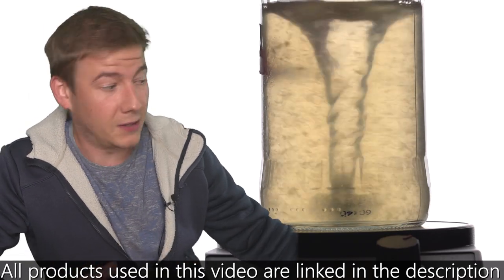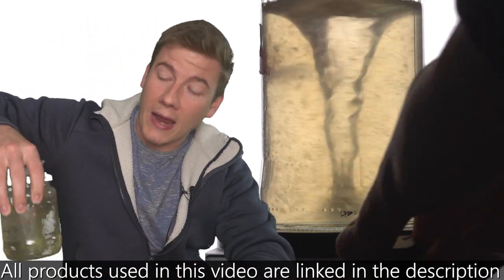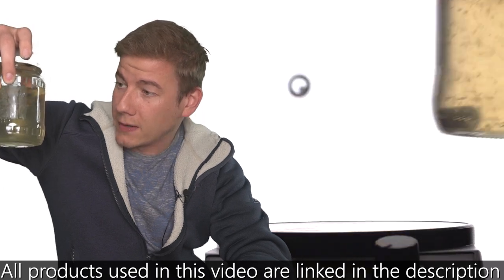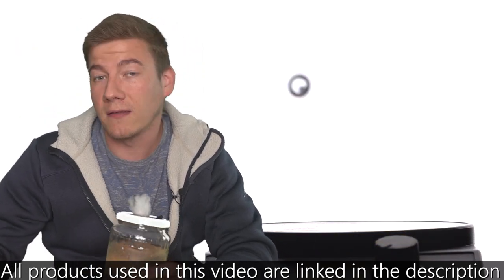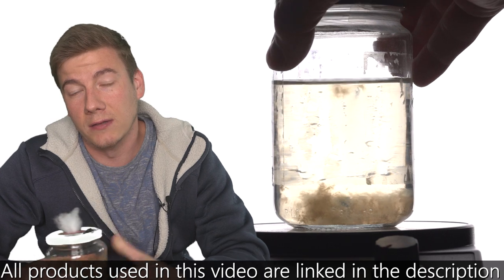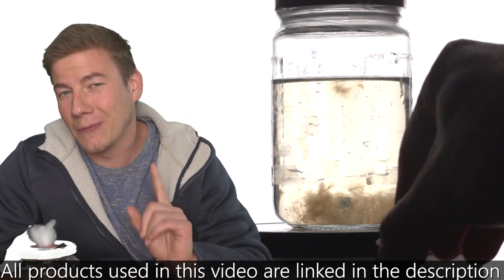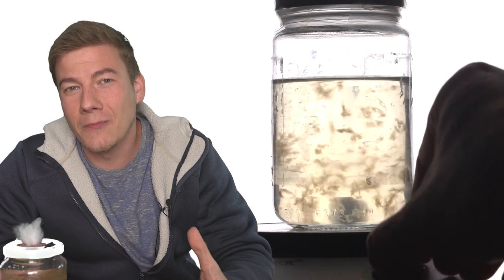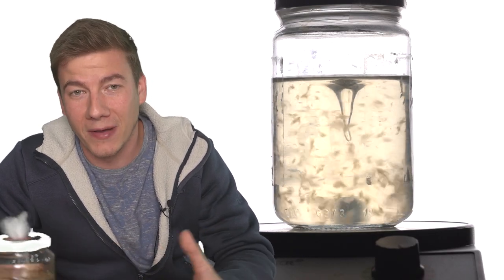Of course this is not needed, you can just mix it by hand afterwards. But when you have a lot of glasses, a lot of mixtures, this really just saves you time. And there's one other reason: it just looks amazing when creating those underwater tornadoes when breaking up the mycelium.